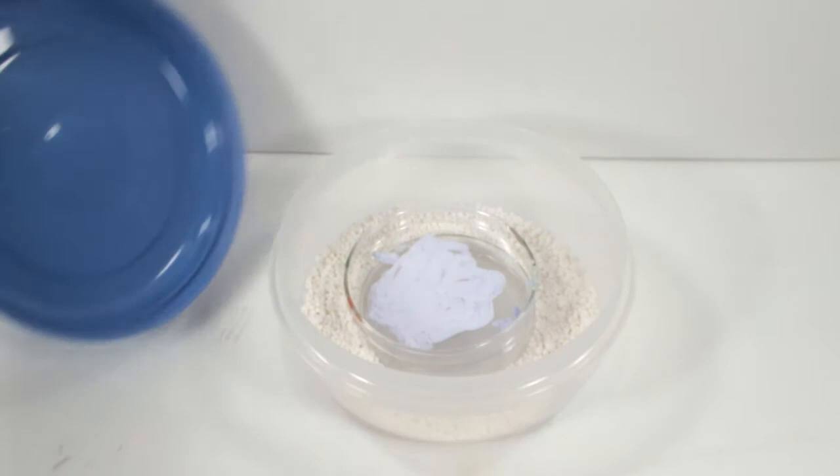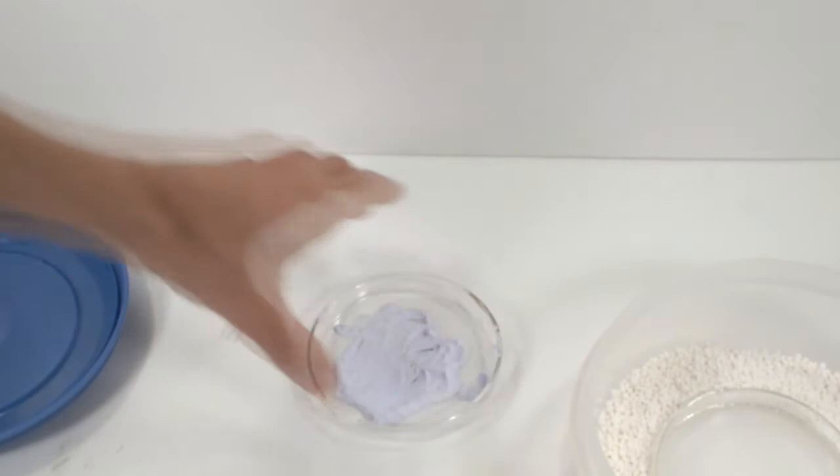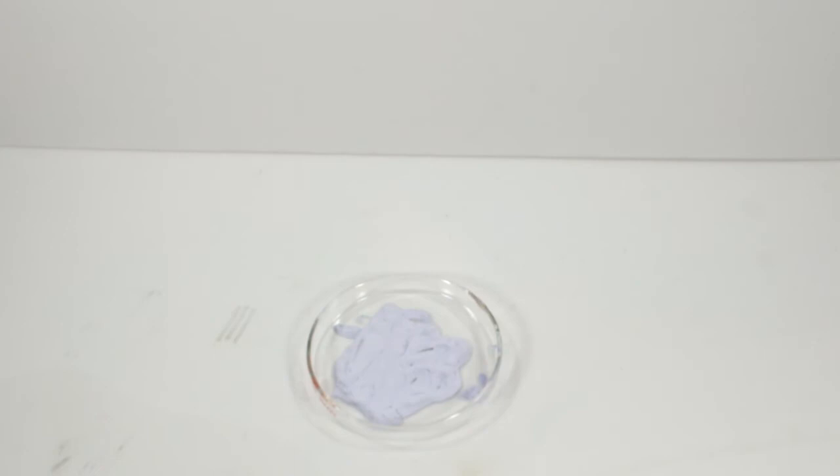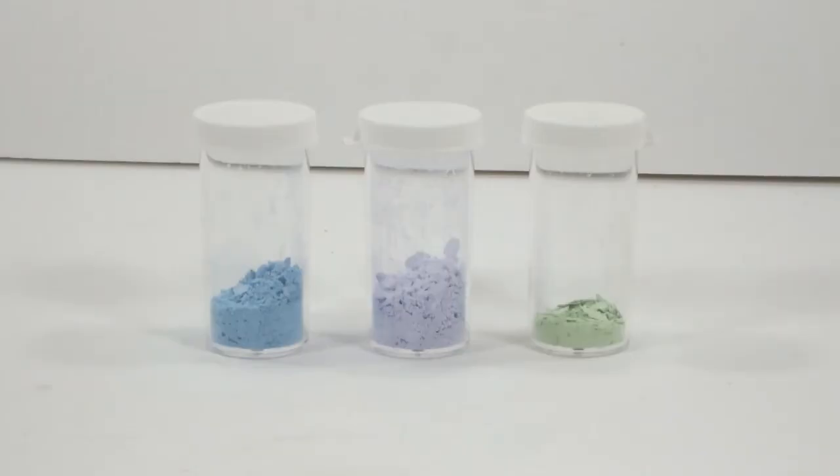All right, here we are a few hours later, and yes, it worked. I have a mostly dry, pale lavender mass that will need some diligent scraping. This is beautiful. The makeshift desiccator is my new favorite piece of equipment, and I'm going to use it a lot. I'm absolutely thrilled with this product.